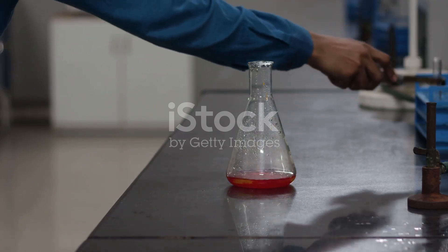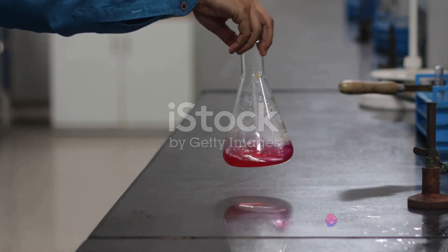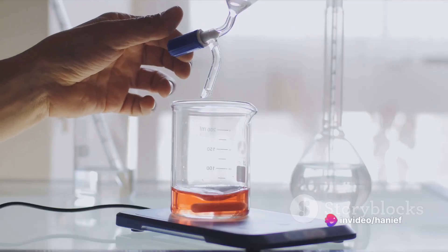Continue adding the sodium hydroxide drop by drop, keeping a keen eye on the solution's color.